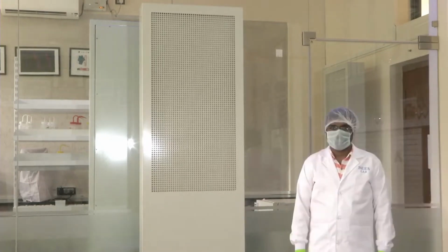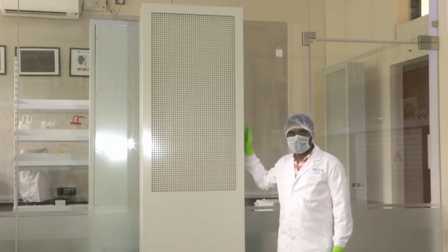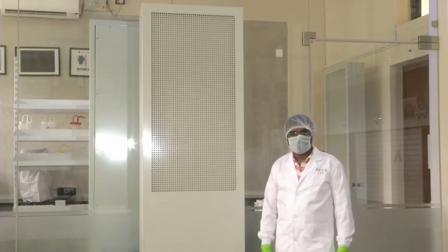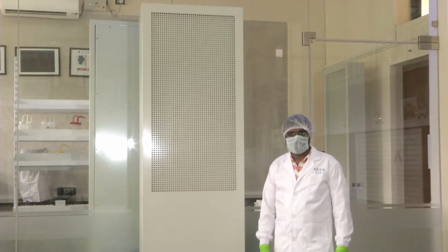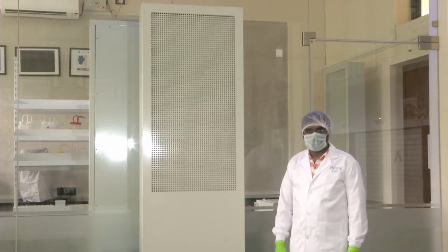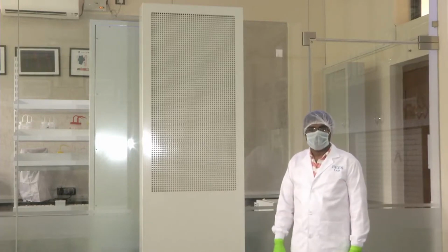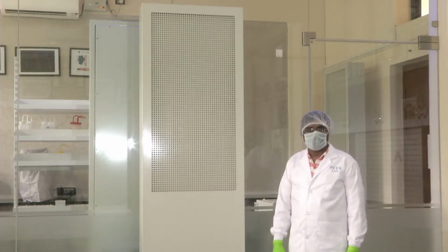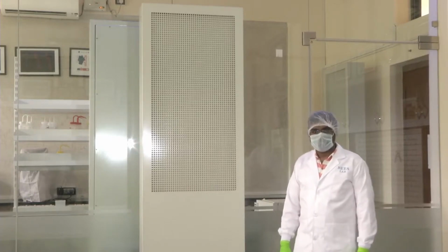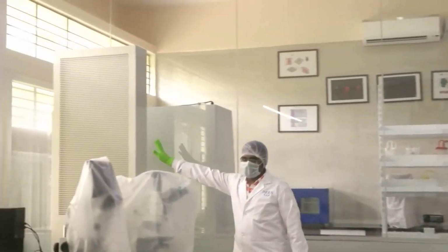The main component used to maintain the clean room environment, as I mentioned, is the HEPA filter. HEPA stands for high efficiency particulate air. The filter system has different components. It has a positive pressure module and a tower module. Sitaram here is standing next to a tower module. The tower module is used to circulate the air inside the clean room environment. As you can see, we have different tower modules within the lab. There is one next to Sitaram. Now he is moving towards the next tower module that we have.